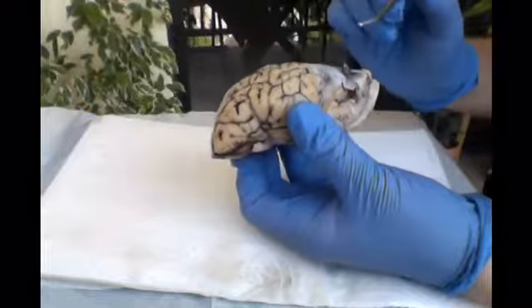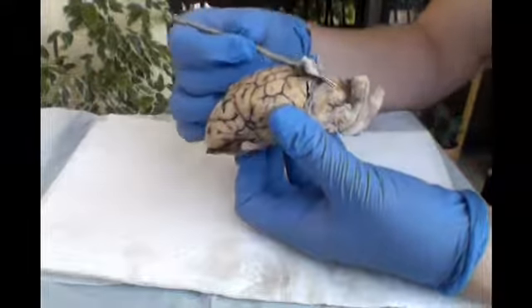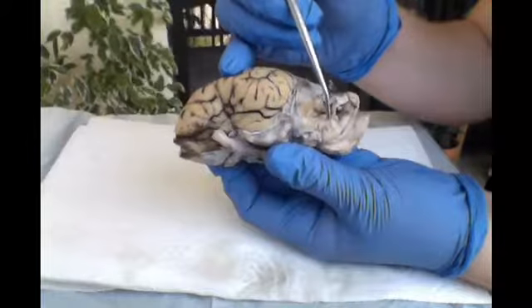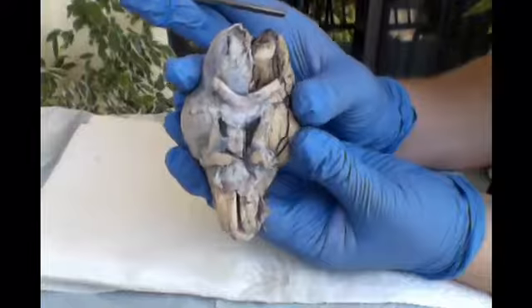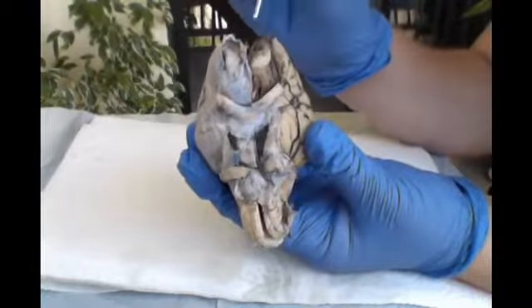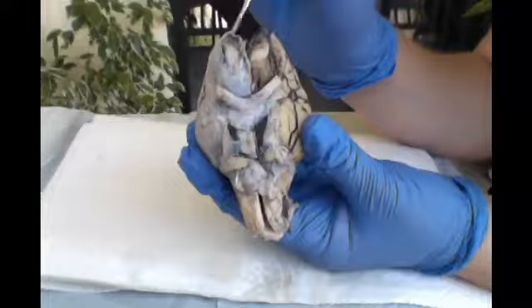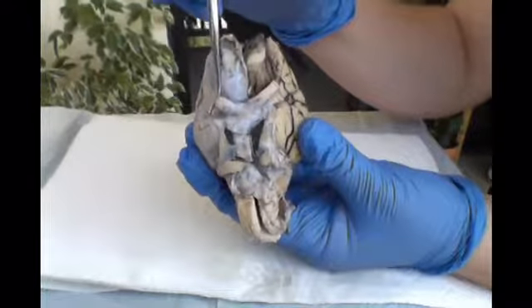Next, I'm going to be showing you the cerebellum, which under this flap is this back piece here. And then looking at the bottom half, we have the pons and the medulla oblongata. Taking the brain and looking at it on the ventral side kind of looks funny. Up here we have the olfactory bulbs and olfactory tract that leads them to the front of the head. The optic nerves are these on both sides.